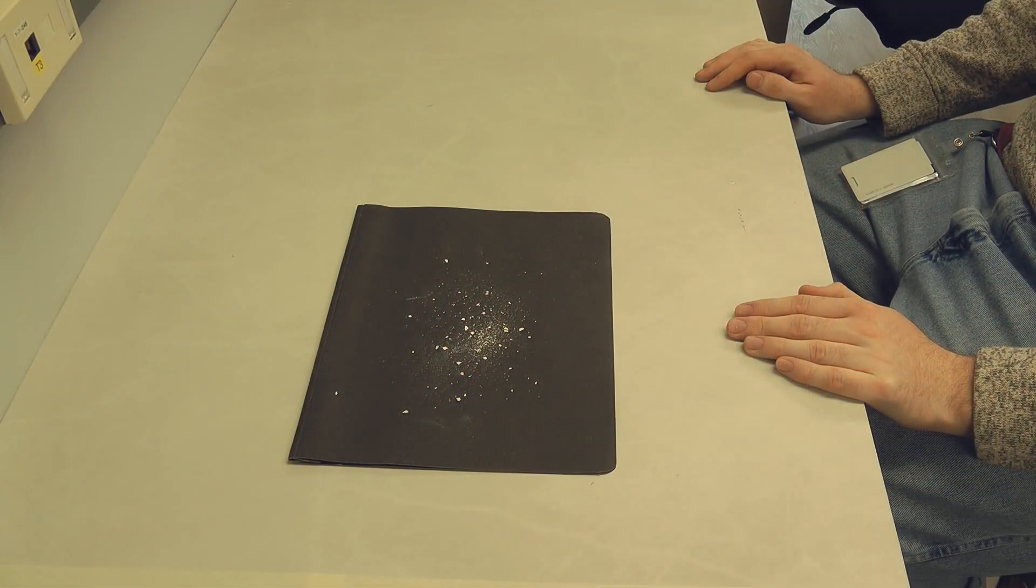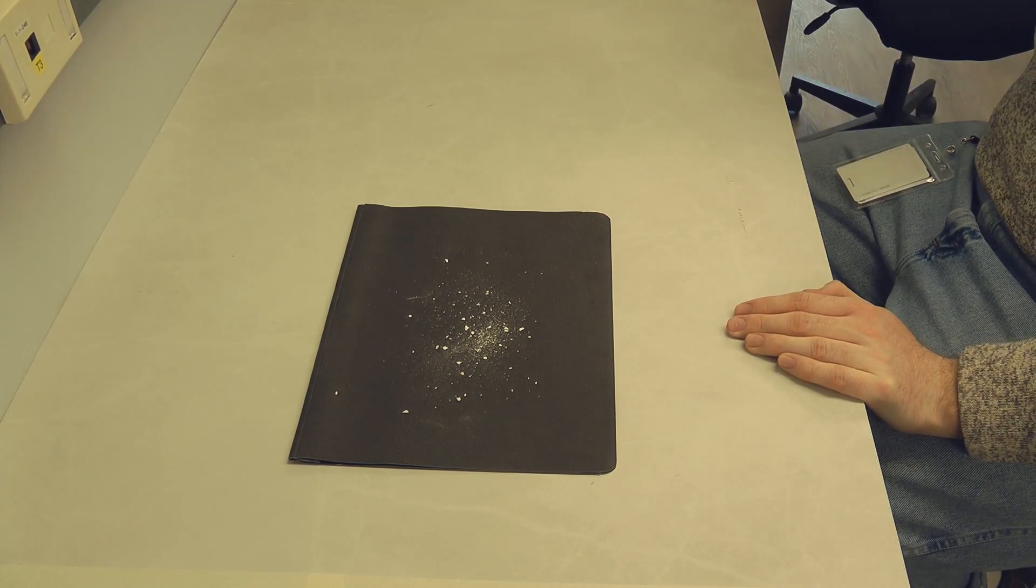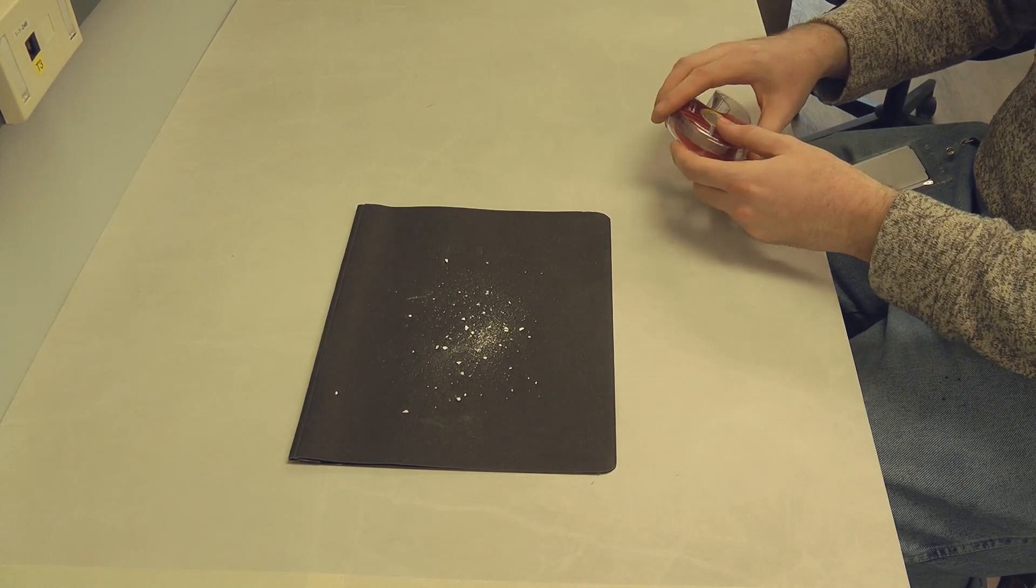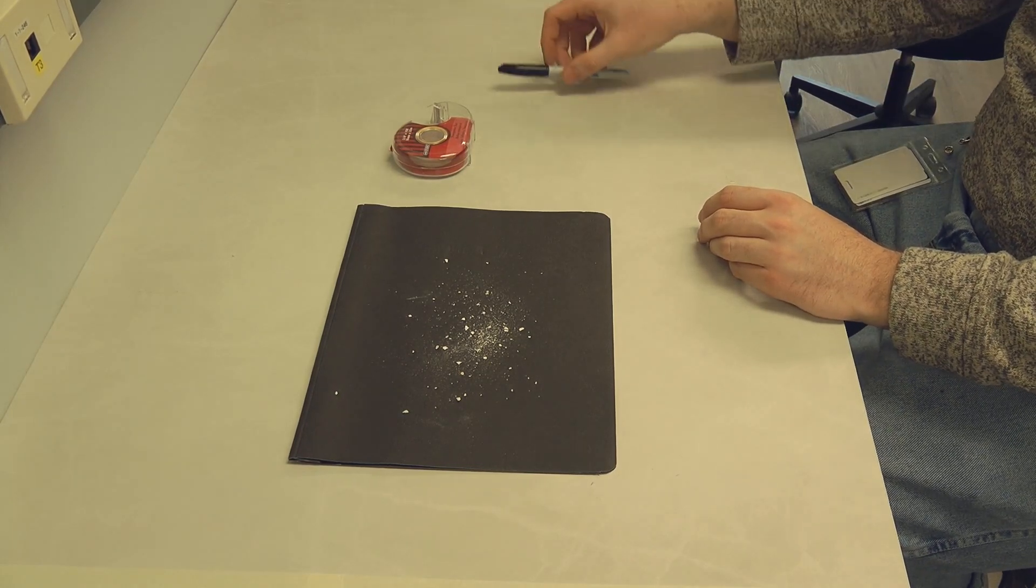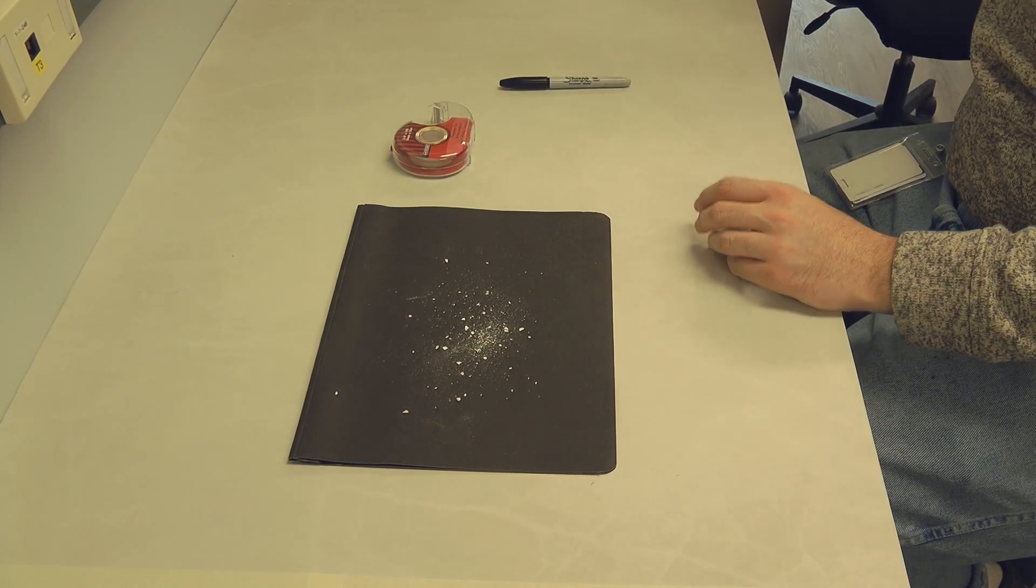Our laboratory is often asked to identify dust precipitated on furniture, but when the amount of dust is so small that it's hard to scoop, it may be difficult to collect a sample. Today I will show you how to collect trace amounts of dust for microscopic examination.